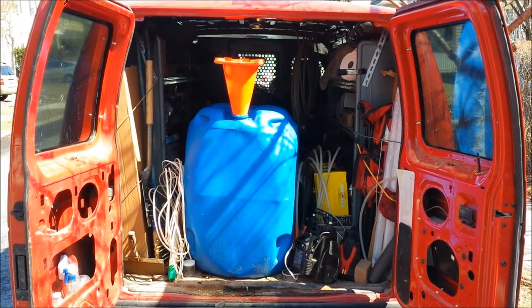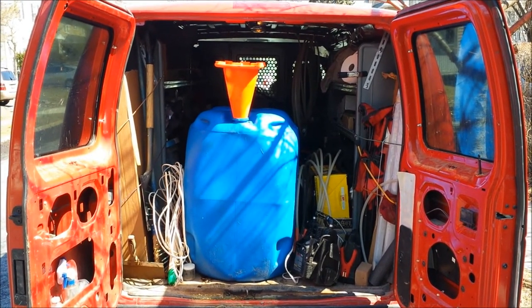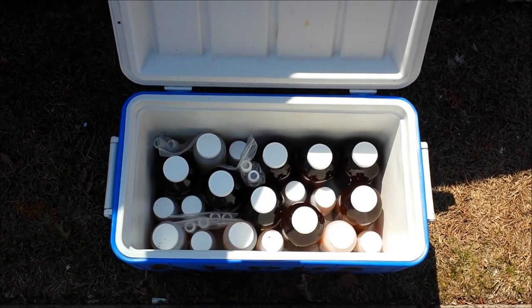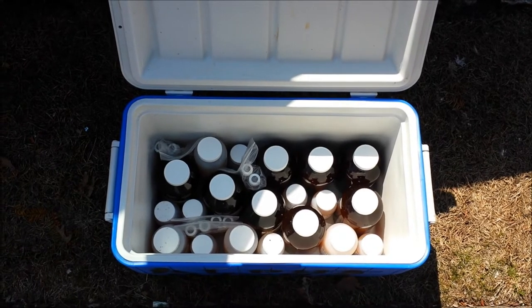Here's what we do with all that purge water — put it in our Marksman Mobile Purge Drum. A lot of effort went into it, but our work is done. Now it's time to get some ice on these and get them over to the laboratory. So you've seen groundwater sampling — we've shown you static water level collection, physical parameters, collection of sample, purge volumes, all that stuff. For more information about groundwater sampling, check out our website, marksmanenterprise.com, or check out our upcoming video series, In a Classroom with Marksman. Until then, this is Glenn from Marksman, where we'll continue to clean up the earth one oil tank at a time. Take care.